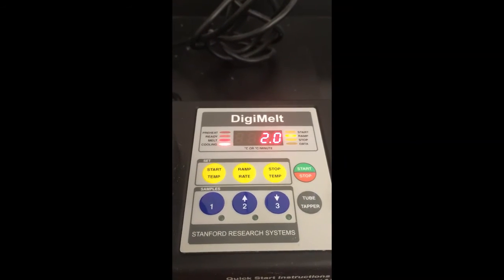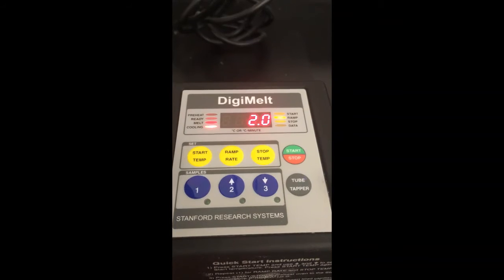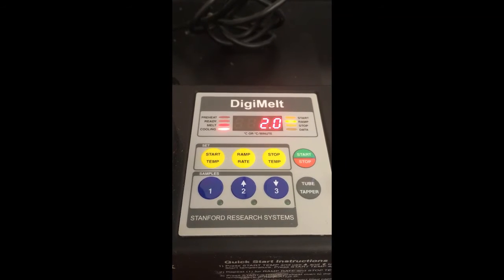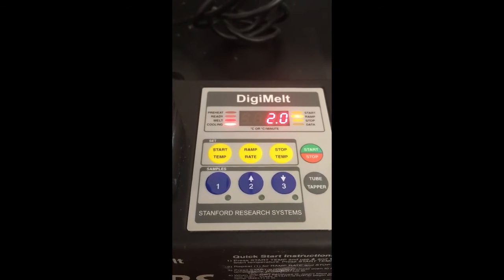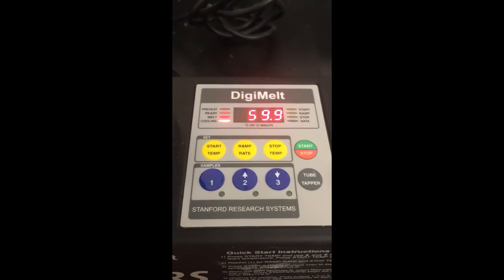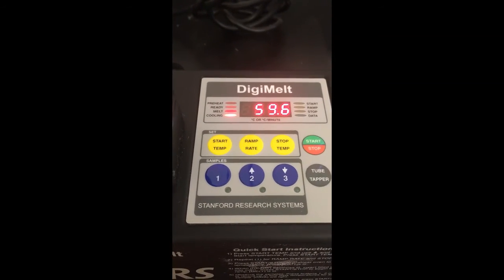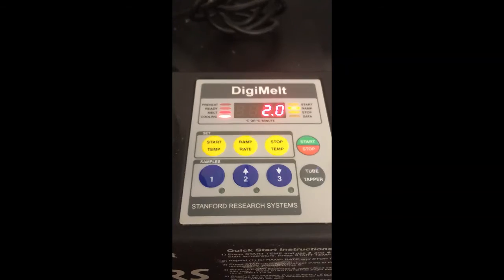The reason that those are inappropriate is because the onboard thermometer that measures the temperature of this heating block might not actually be able to keep up with a ramp rate of 10 degrees per minute. That's a phenomenon referred to as thermometer lag, meaning that the block will actually be hotter than the displayed temperature on the instrument. The reason that's an issue is because it can lead to you recording a melting point that's lower than the actual melting point of your compound, so it introduces error to the experiment. So a ramp rate of 2 is typically a good choice.